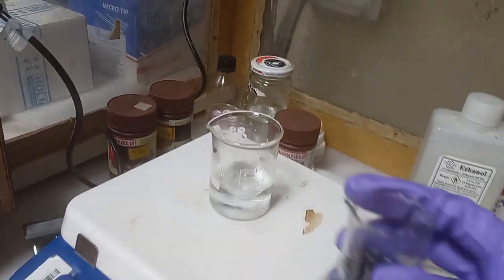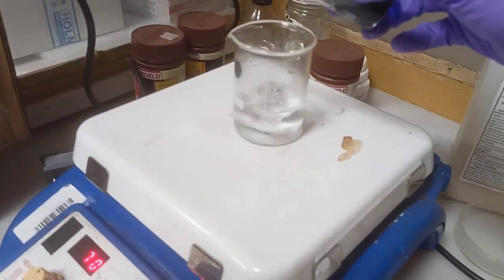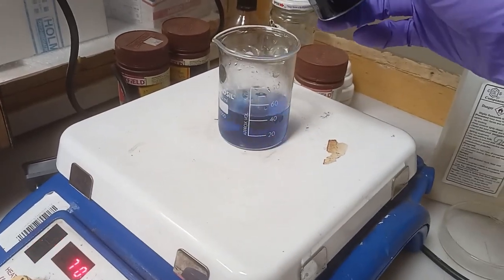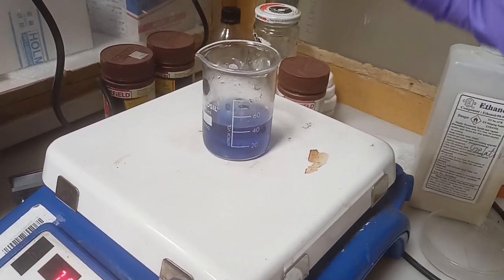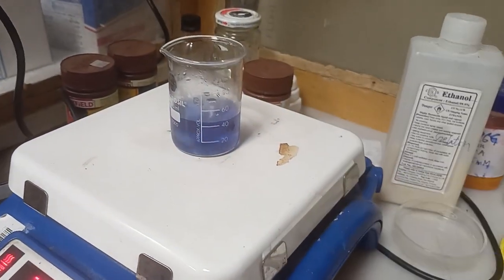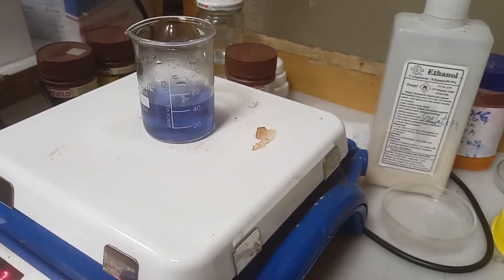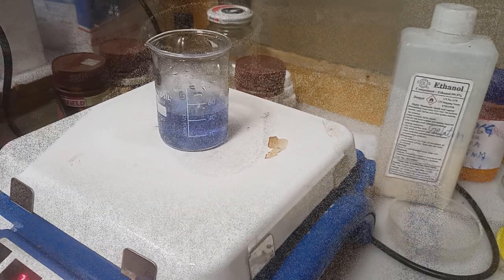Now I will add this master liquid to this and let us see how the color changes. I have added a few amount to this and as time goes by the color will actually disappear and it will become transparent.